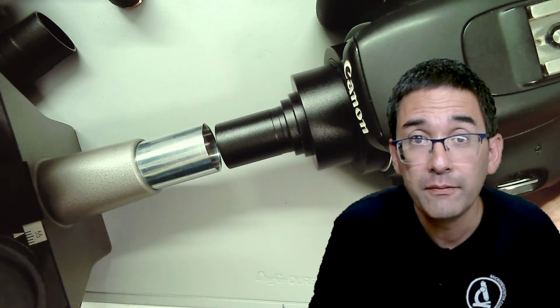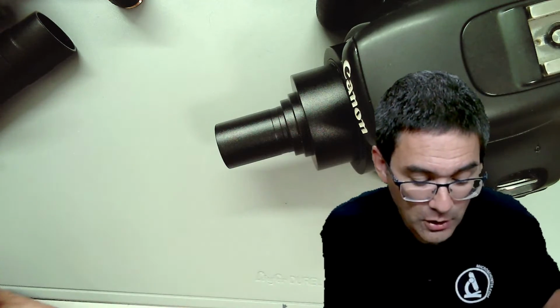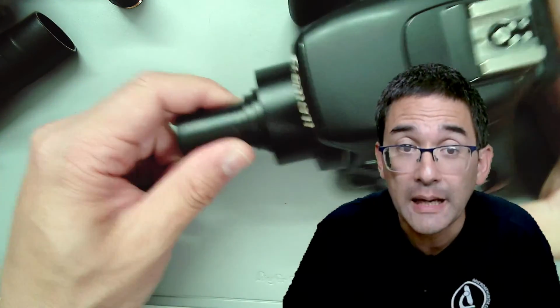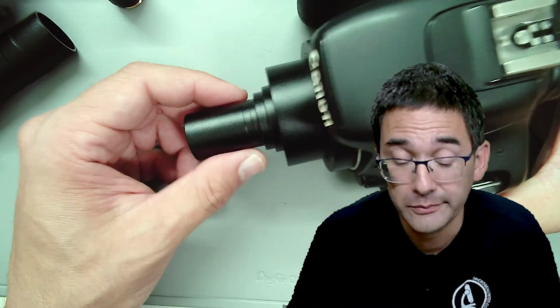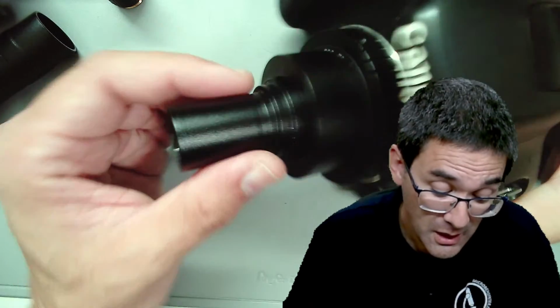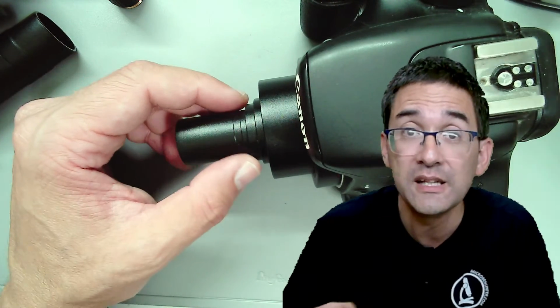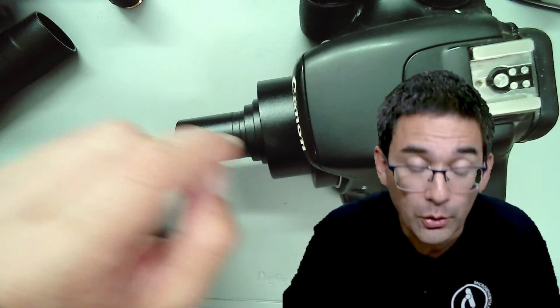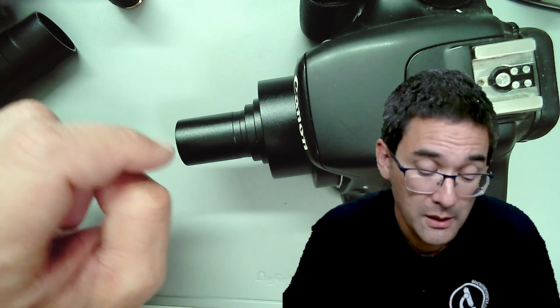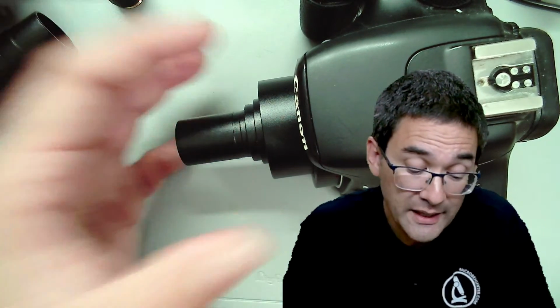And now we have an issue, and this issue is the following. These are general purpose adapters, relatively cheaply made. They're okay, but the problem is that these adapters also introduce lens errors like chromatic aberration. This is where you get this purple and yellow fringing. These are not perfect. So this is a general problem, and I have tried this adapter here.